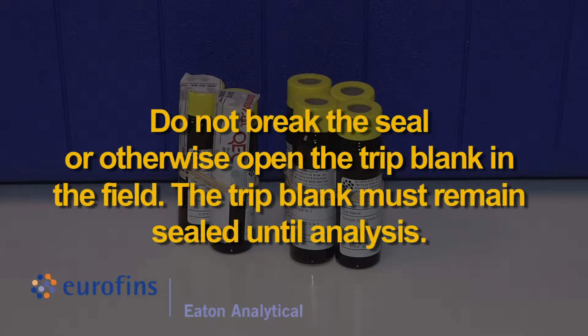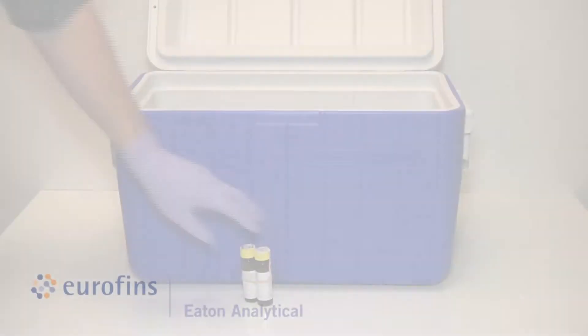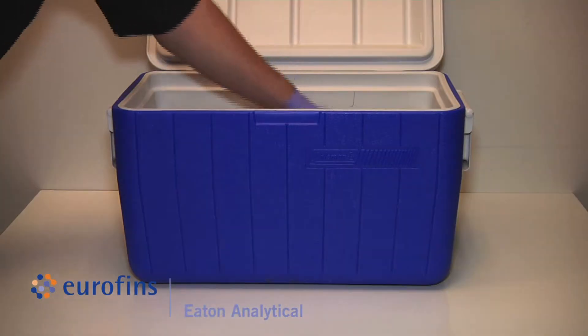Do not break the seal or otherwise open the trip blank in the field. The trip blank must remain sealed until analysis. Ship the trip blanks back to the lab along with the samples.